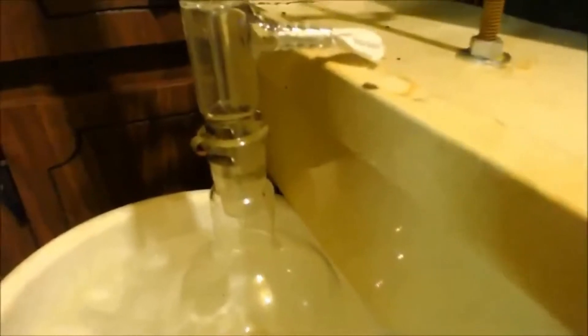I should have put some ice water in there to cap it, because this stuff is real dense and it would sink to the bottom and form two layers. The ice water on top would keep it nice and cold. There's nothing in the top portion. I don't let anything get up past the bigger condenser. I really wish I put water in there so it would form two layers — it's all just one layer. I don't know if that's pure — obviously not pure pure, but I don't know if that's mostly my product or what. It's not forming two layers. You can see the vent port going out to the atmosphere — I put a tissue in there so it doesn't build up pressure but keeps the vapors in. I don't smell anything. You can tell the drip rate's going slower now — before it was going like crazy.